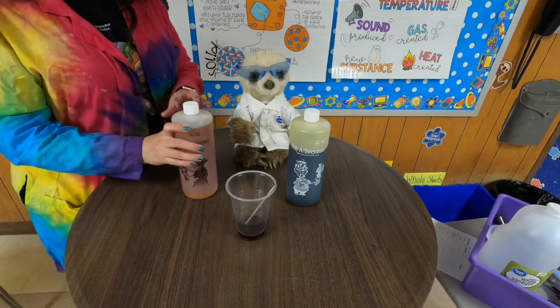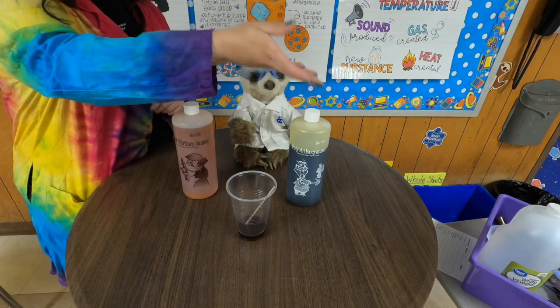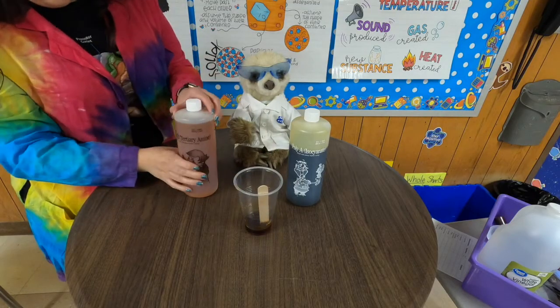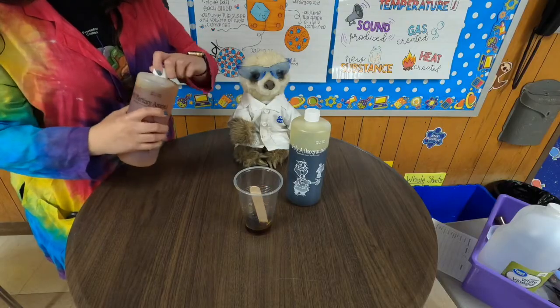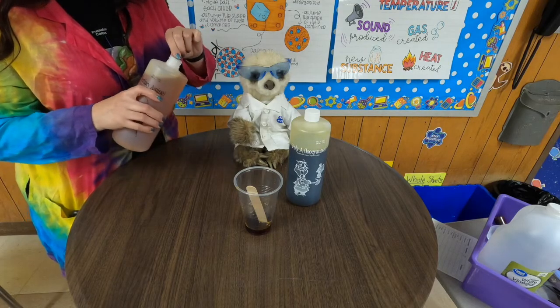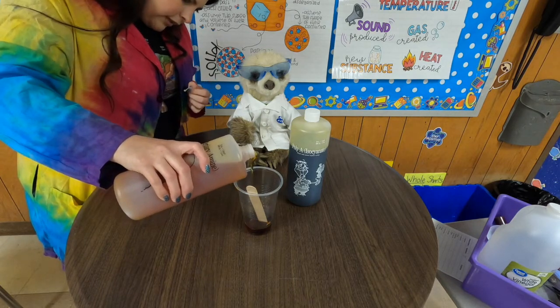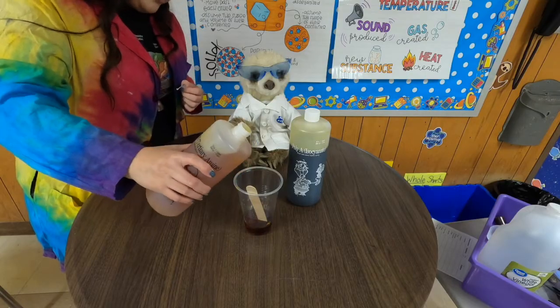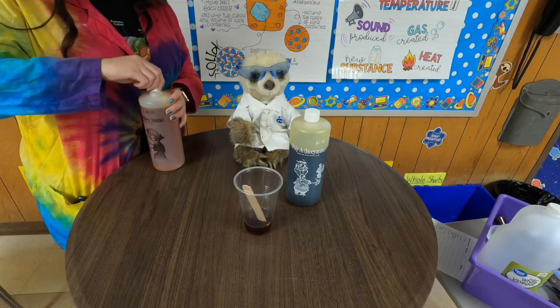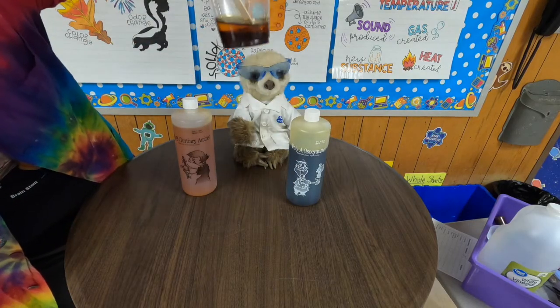For our next demonstration, we have two polymers, which are basically plastics. We have polymer A here, which looks kind of like syrup, and it's got a syrupy consistency. Then we have polymer B, and I'm going to add it to polymer A, and then I am going to mix both of them. You'll notice that they do have a difference in density. Polymer A is more dense than polymer B. So you'll see polymer A, the darker one, sink to the bottom or stay at the bottom, and then polymer B will float on top of it. You can kind of see it right there.